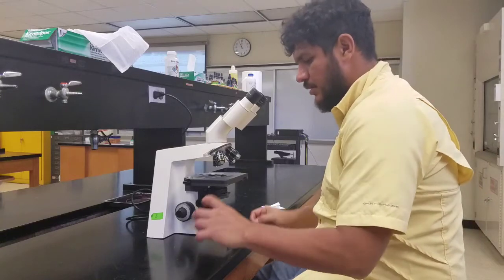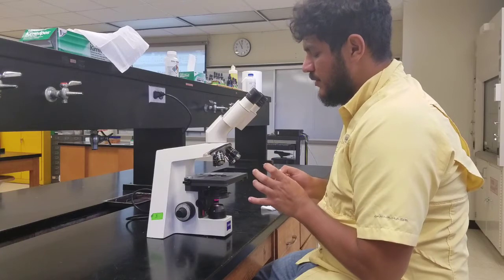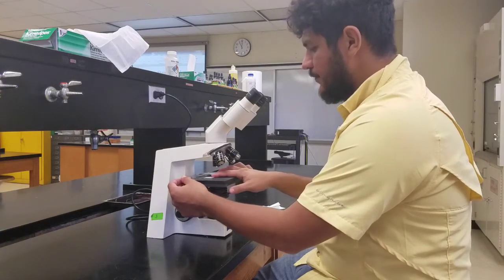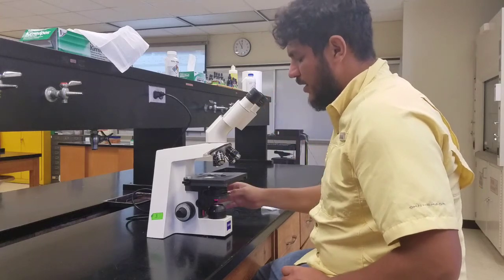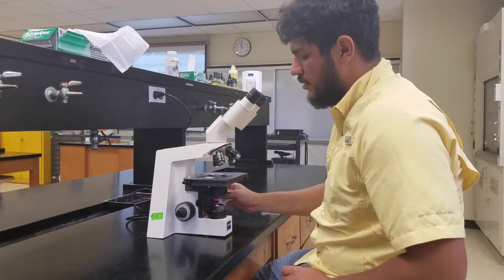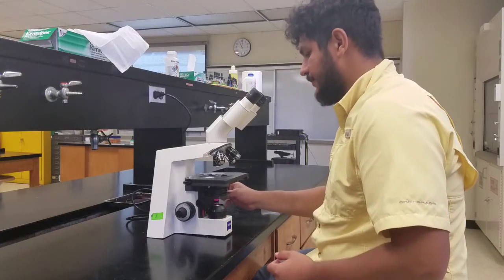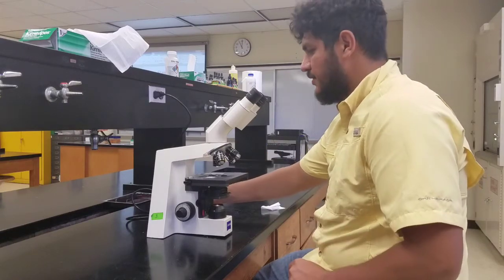and proceed to set our microscope slide onto the stage. To do this, we are going to open the stage clip, slide the microscope slide in, and close the stage clip. Now, with the stage knobs, I can move it, and if I check and my microscope slide is moving freely, it means that I have it properly set. Now with this, I can adjust the light of my microscope on the knob on the right.